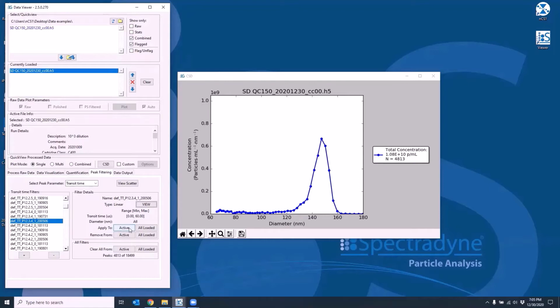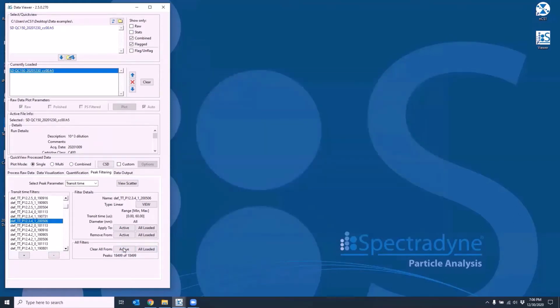The Active option will apply the action to the currently highlighted file. The All Loaded button will apply the action to all files in the currently loaded frame. Now, both of these will only apply to the selected parameter. The Clear All From option under All Filters will clear filters from all parameters. Now we're going to clear all default filters to apply our own custom filters. To create a new filter, use the Add button at the bottom of the available filters list.